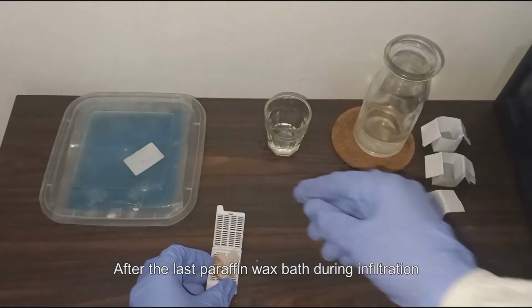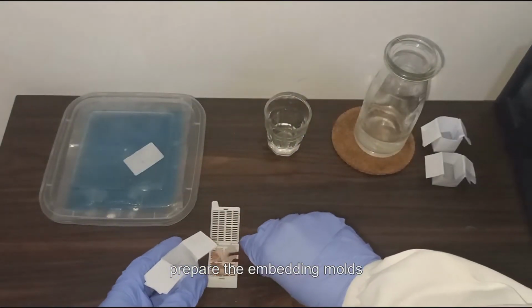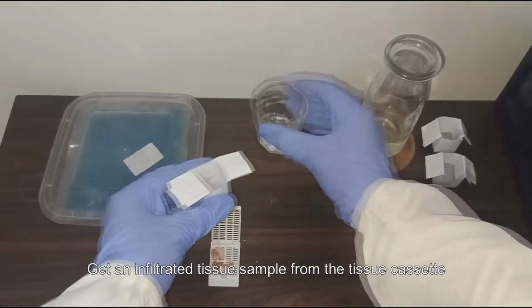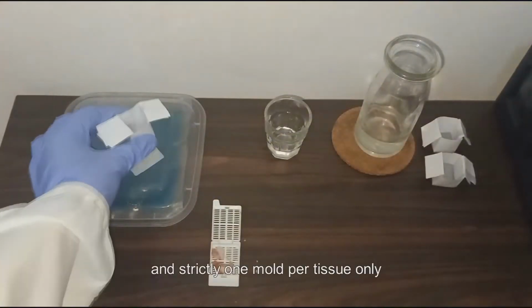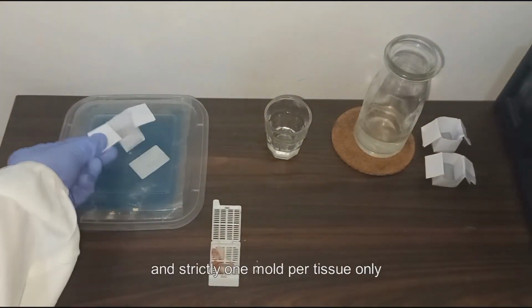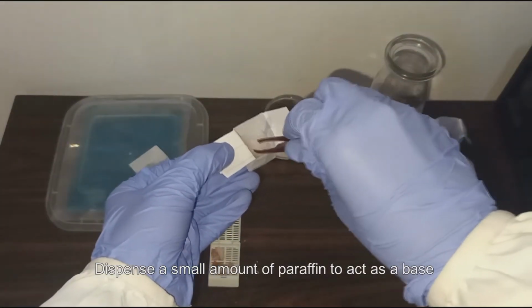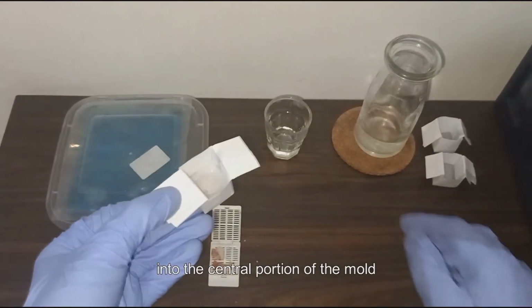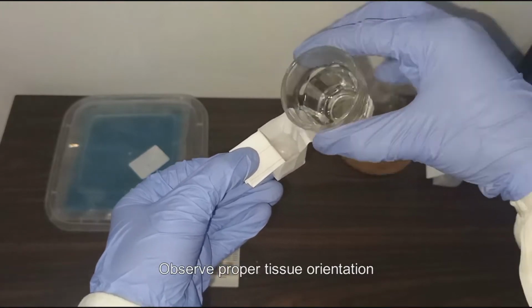After the last paraffin wax bath during infiltration, prepare the embedding molds. Get an infiltrated tissue sample from the tissue cassette. Remember to attend to 1 sample at a time and strictly 1 mold per tissue only. Dispense a small amount of paraffin to act as a base and immediately transfer the tissue into the central portion of the mold. Observe proper tissue orientation.